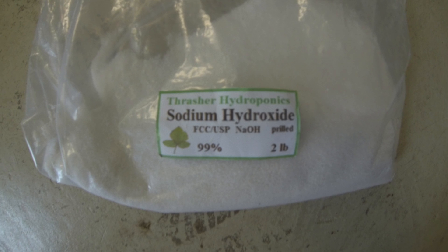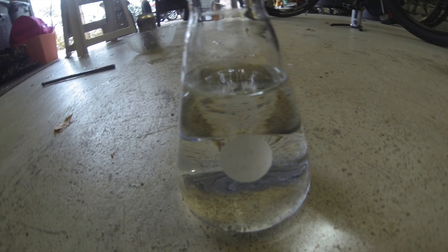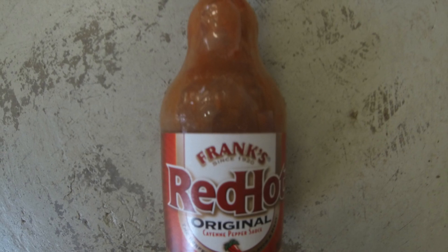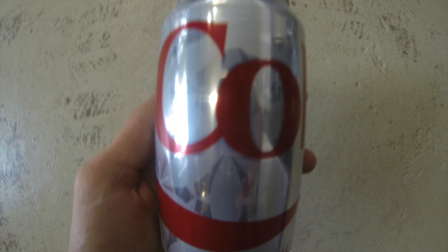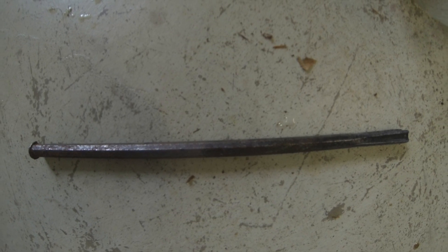In this video, we're going to be dissolving a Coke can. The materials you'll need include sodium hydroxide, 200–250 milliliters of water in a beaker, or some kind of acid — hot sauce works. You're going to need a Coke can and some kind of stir rod.